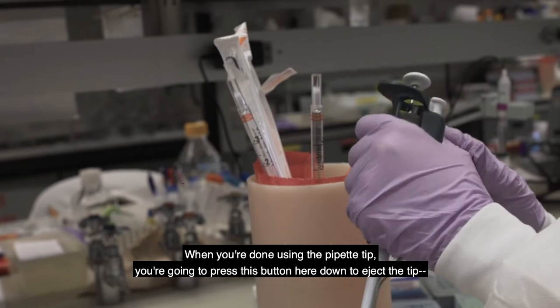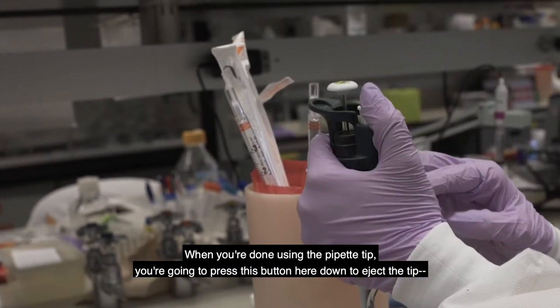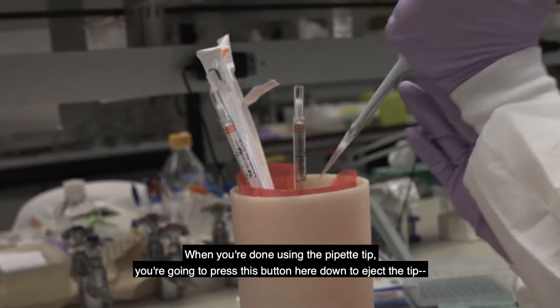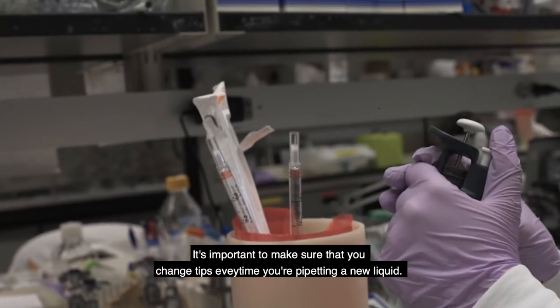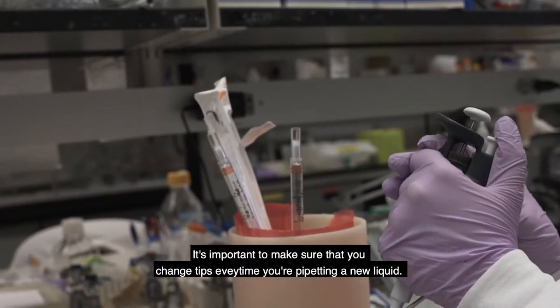When you're done using the pipette tip, you're going to press this button here down to eject the tip like that. And then it's important to make sure that you change tips every time you're pipetting a new liquid.